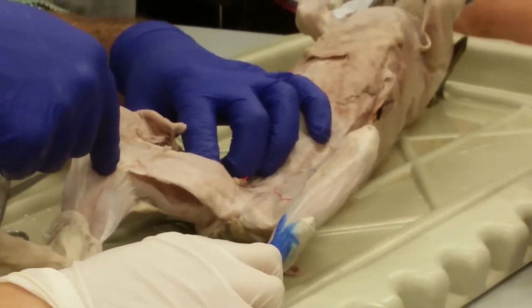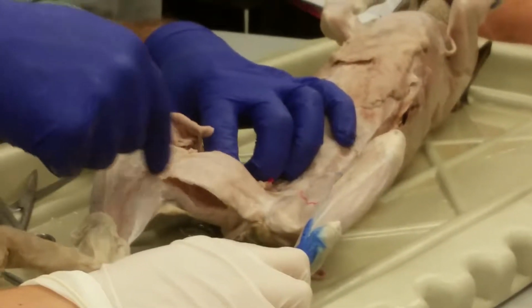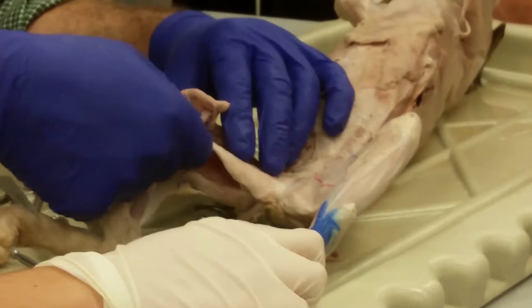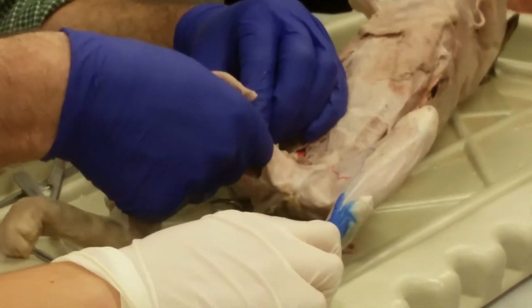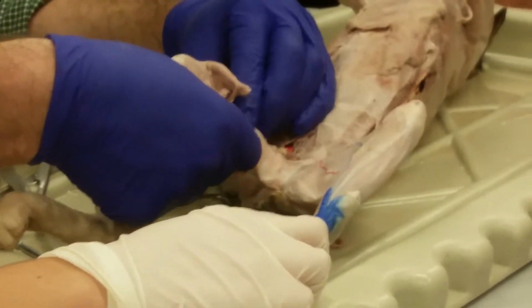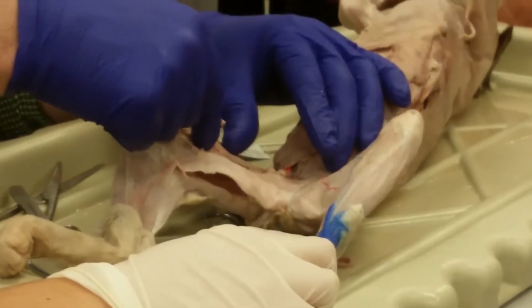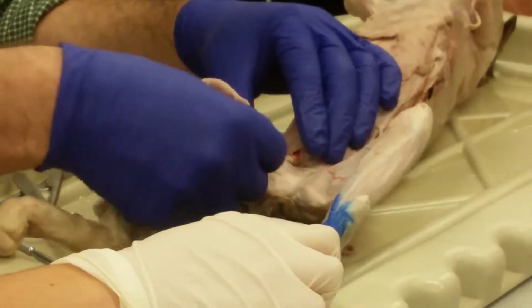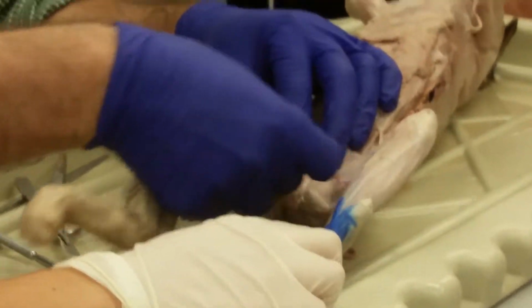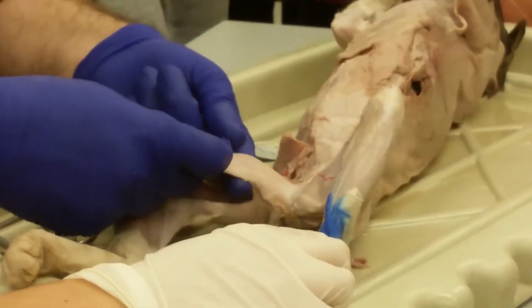What joints does it cross? Two joints. The hip and the knee again, right? All right. Let's do the knee first. It's pulling from behind the knee, as you see. So what's it going to do? Flex. Flex the knee, right? It's pulling right along the middle from the midline down here. So what's it going to do to the hip? Adduct, right? You can only do one of those because it's pulling from the middle. You can adduct, okay? All right, so that's gracilis.